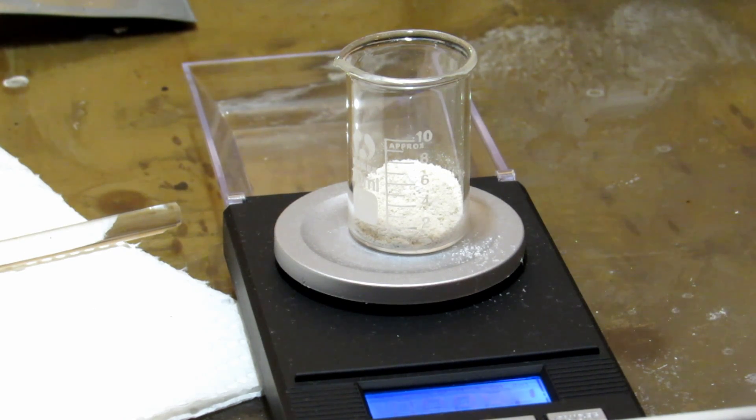It's neat that we were able to extract caffeine, but I don't plan on doing any other videos on it because it's not actually really that useful. That's essentially how to extract caffeine from coffee. For one entire kilogram of coffee, we were able to extract one gram of caffeine. Certainly if you were to go to the store and buy some caffeine pills or something, you could do a much better extraction. It's just kind of difficult to extract from coffee. You could try this method. Perhaps you get some more and you get a better yield. But we should definitely be in the higher range than just one gram. But I'm still happy that we have that. That's all I wanted to do was try to extract some, and we succeeded. I hope you guys enjoyed, and I'll see you in a future video. Bye.